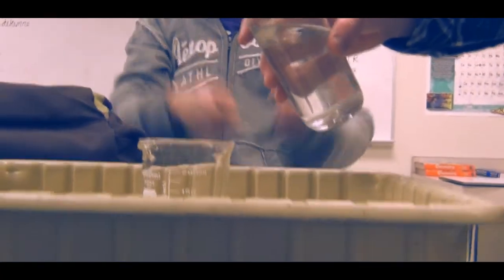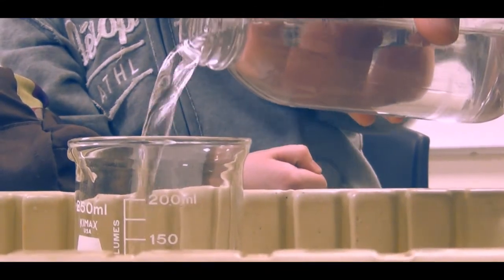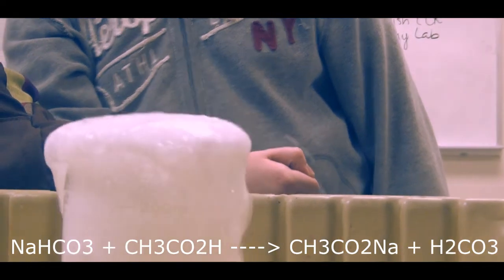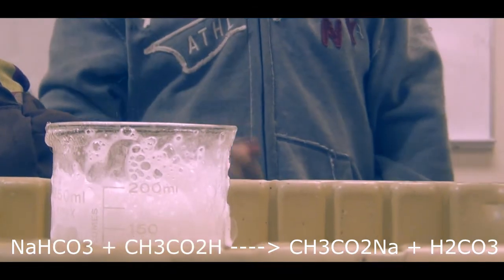The final type of chemical reaction is the double replacement reaction. In these reactions, the anion and cation of 2 different molecules switch places, forming 2 entirely new compounds. In this case, acetic acid is poured into a beaker containing bicarbonate of soda. You know these compounds as vinegar and baking soda, respectively.